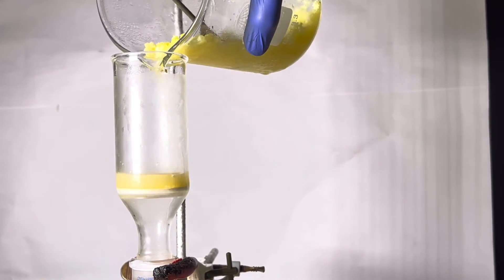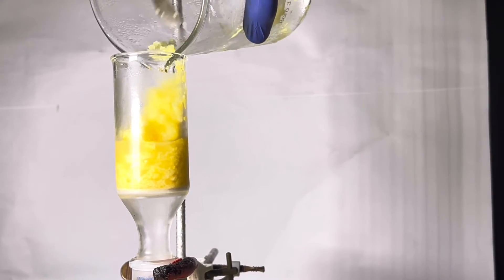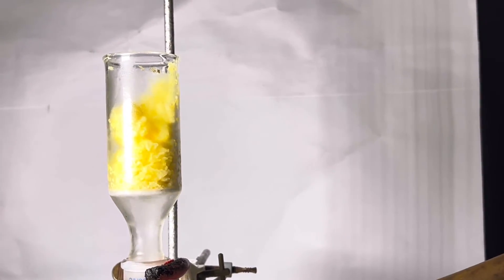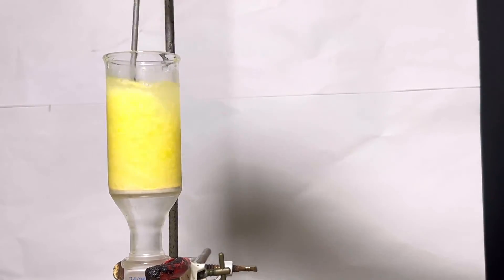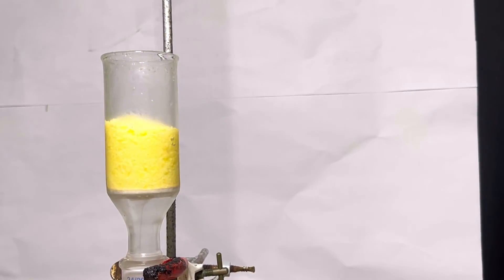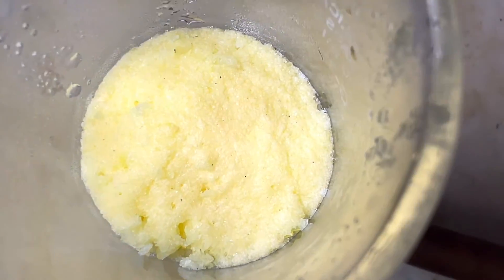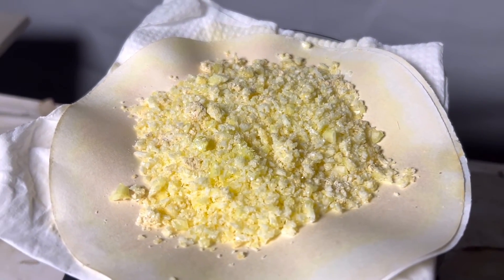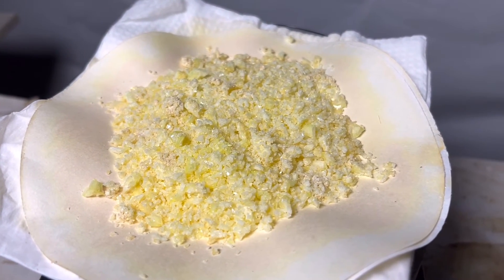Assuming this was barbituric acid, I proceeded with filtration using a vacuum setup. After draining the liquid, the crystals were washed with ice-cold water twice and drained. The crystals had a pale yellow color and there was some pale pink colored precipitate also, which I have no clue about.